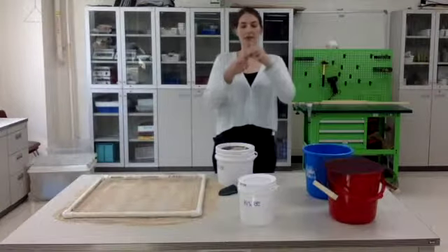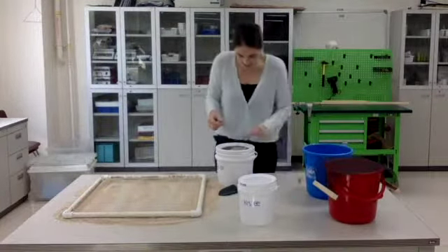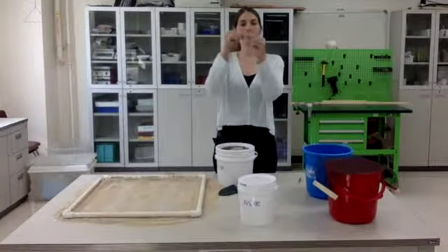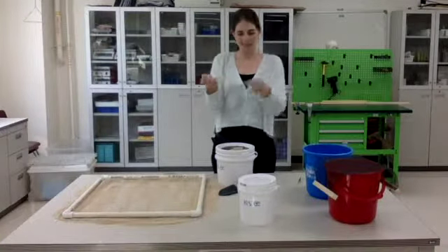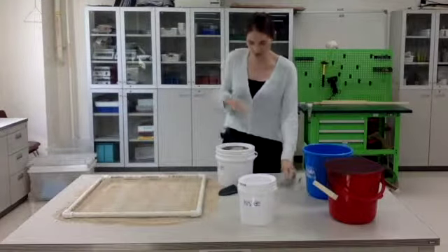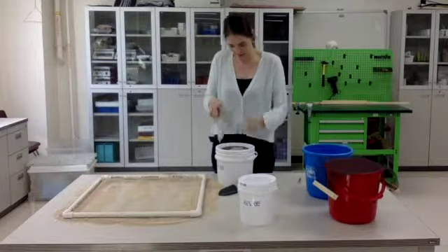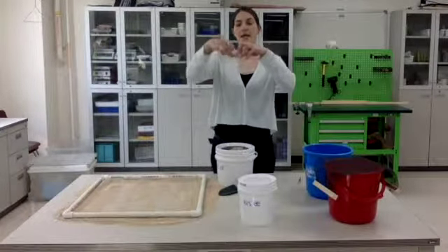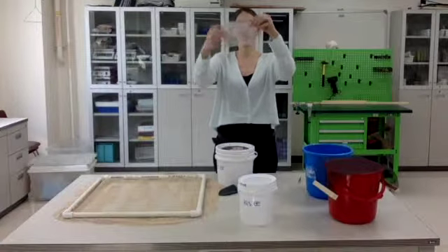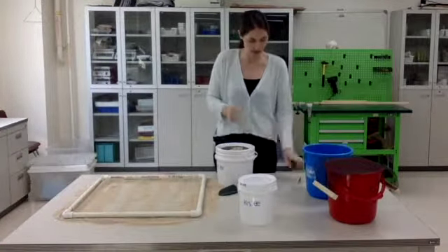So I got a lot of the little plastic pieces. The other things are pieces of plastic bags. So I don't think they're going to fit into my microtubes, so I think I'm going to have to just put them into my baggie. There. Woohoo! All right. That was a bumper crop of plastic in that one.